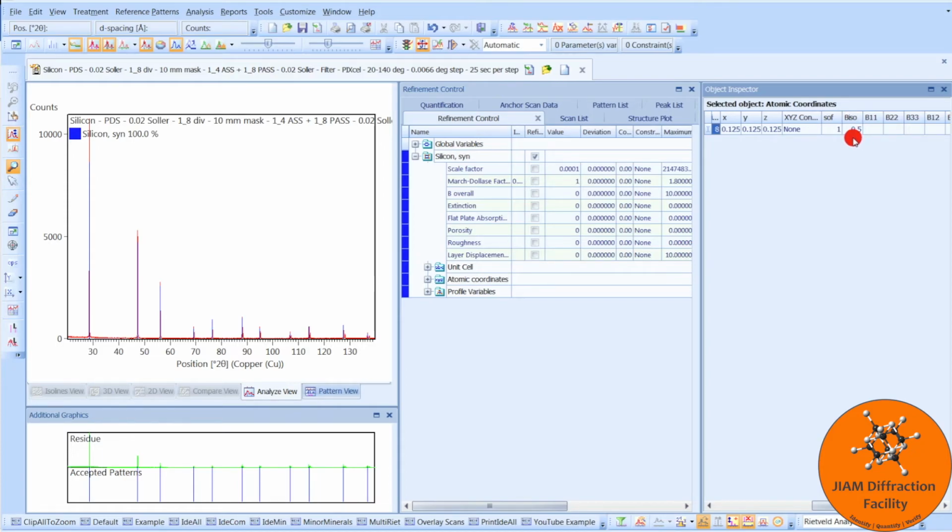Next, we have B iso, which is the isotropic atomic displacement parameter, also known as the thermal parameter. This value will affect the intensity of your peaks, so it is good to have an accurate value if at all possible. Unfortunately, one value doesn't work for all elements, as B is larger for light elements and smaller for heavy elements. Sometimes journal articles or CIF files will contain a number for B iso, and if you believe that number, you can enter it here. I have seen different CIF files for the same phase have very different B iso values though. While not ideal, you can try a default value if you just can't find a more reliable value to use.